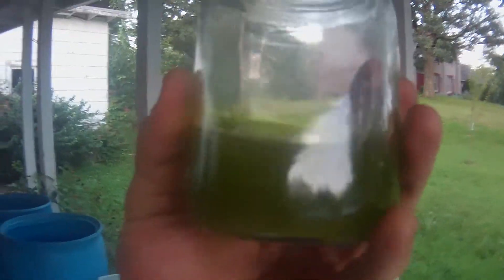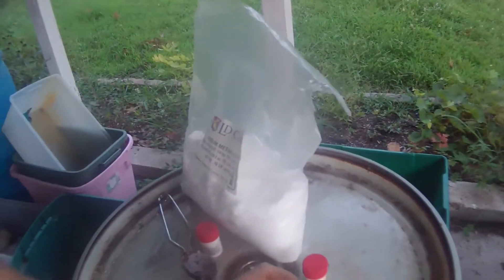I'm going to show you guys how to drop out some gold. This here is technically called chloroauric acid — it's about eight to nine grams of gold dissolved in a mixture of nitric and hydrochloric acid called aqua regia. To get the gold out of the acid, we're going to use what's called sodium metabisulfite.